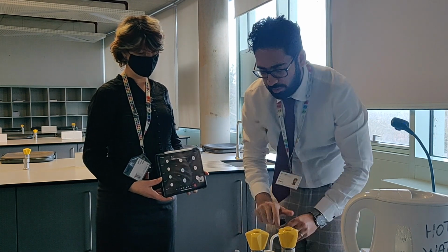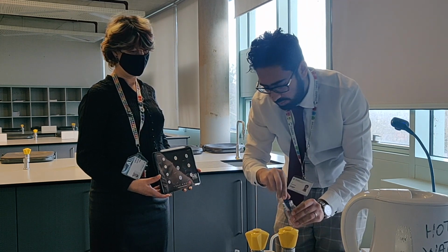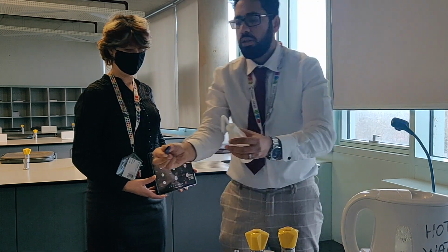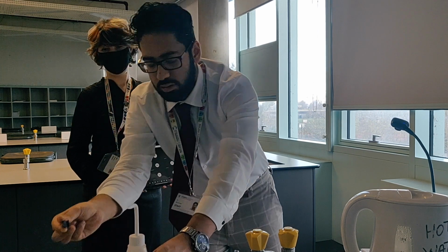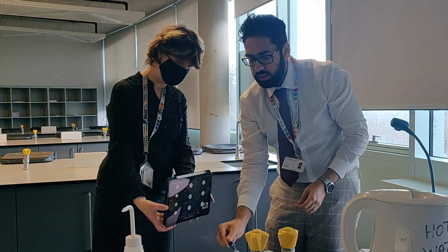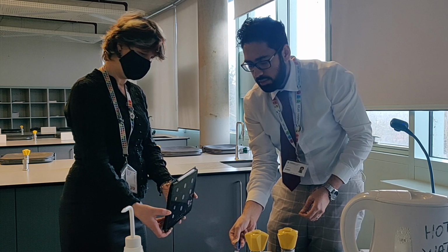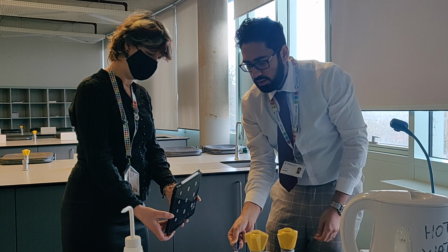Right, then the next step is to get some damp red litmus paper. So I've got some litmus paper here. I'm just going to dampen it a little with some distilled water, and place it over the mouth of the test tube, and I want you to note what happens. There should be a gas evolving, and you should know which gas it is. I can see the fumes, and I can see the colour change. You should be able to see the litmus paper beginning to change colour. You should know the test for this gas from GCSE, and also for A-level.